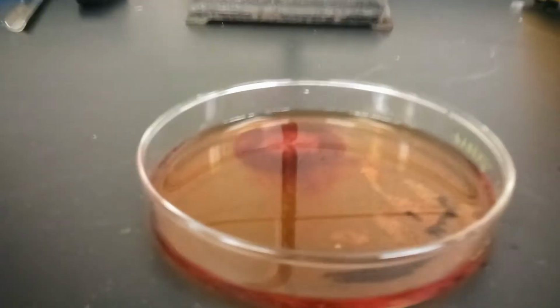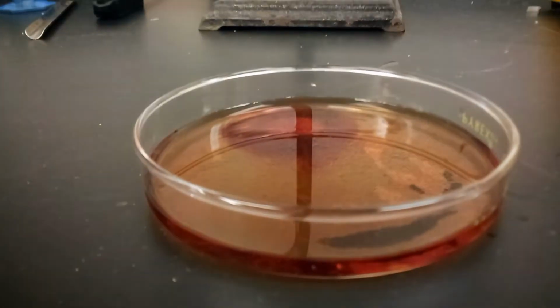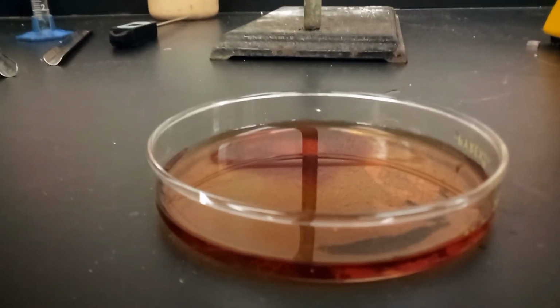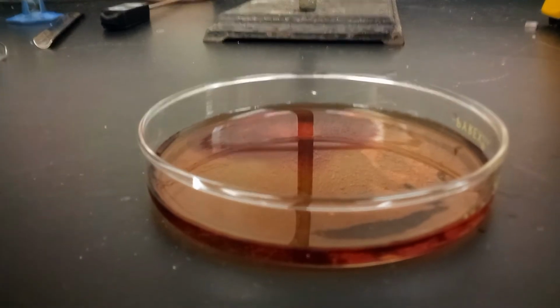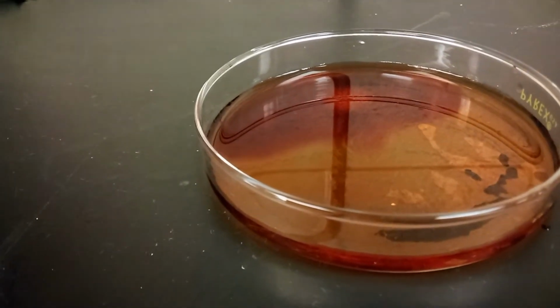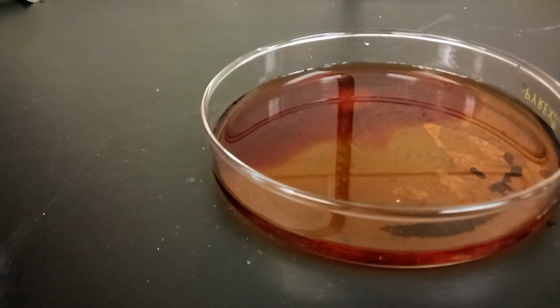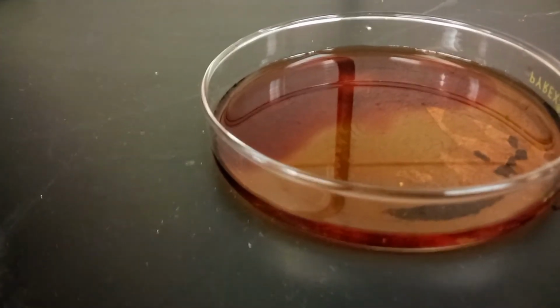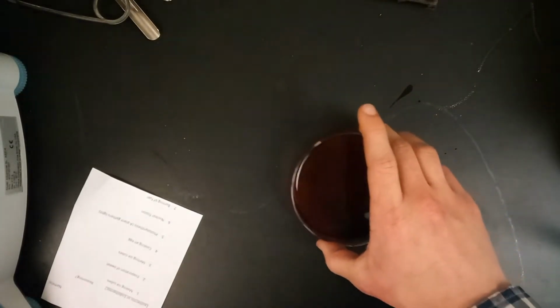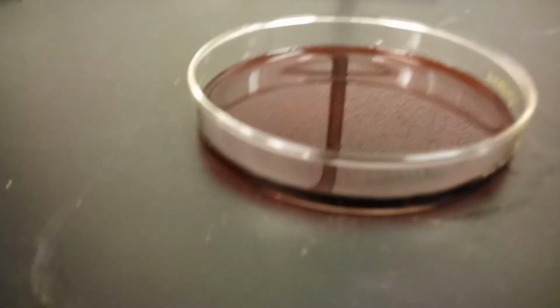Again, we'll get you a closer angle here, and we'll zoom it up for about 30 seconds. Just record the color changes as it happens. You should see that darker red shade starting to come all the way through. So adding more potassium thiocyanate in this step made the color darker. Again, you swirl it so that it's homogeneous all the way through. Now it's an even darker shade of red, almost purpley.